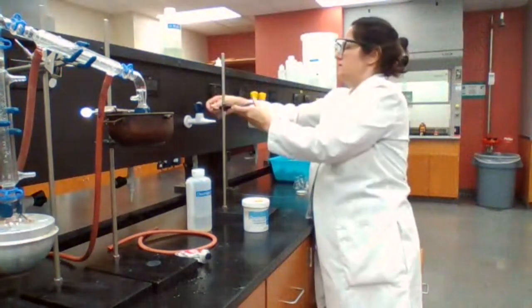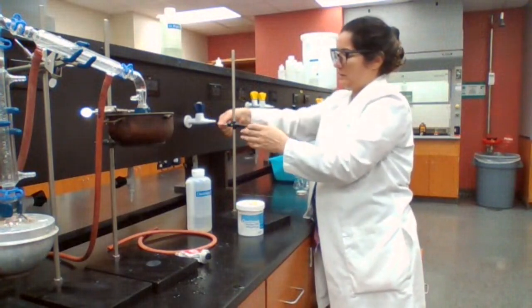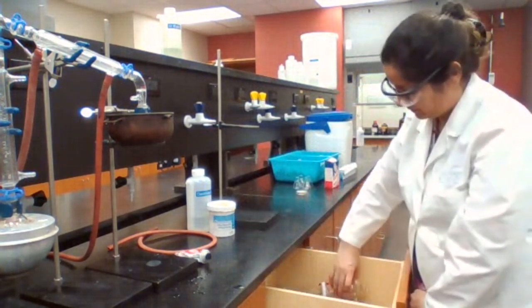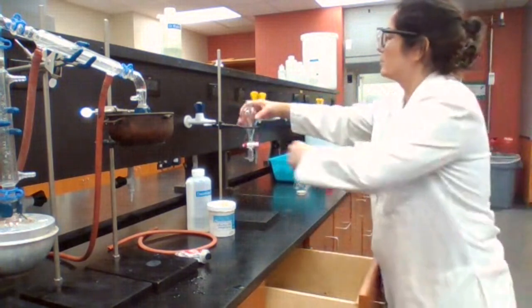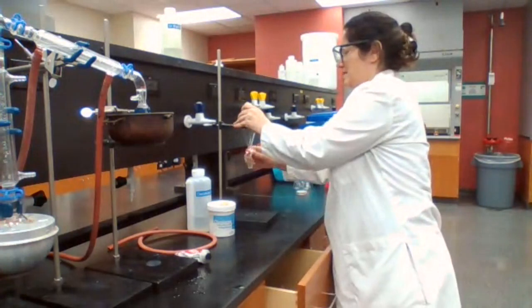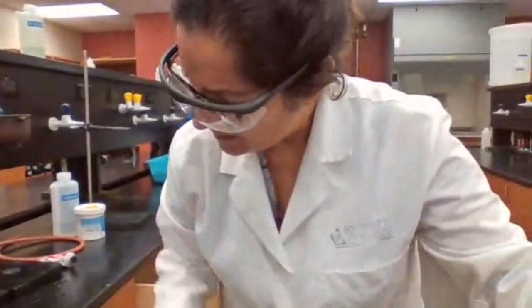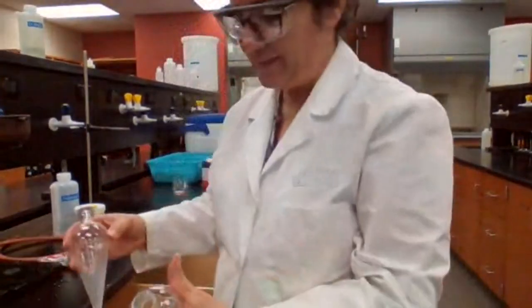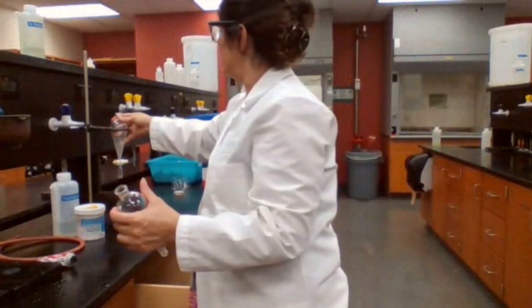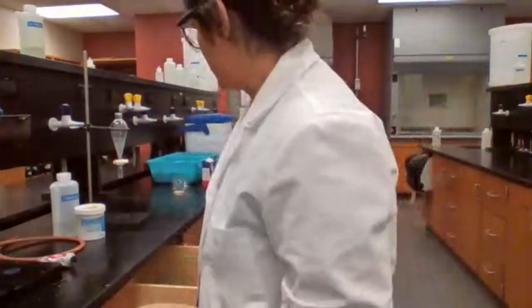Get the extractions ready. And how much water do I have to add? 10 to 15 milliliters of water.